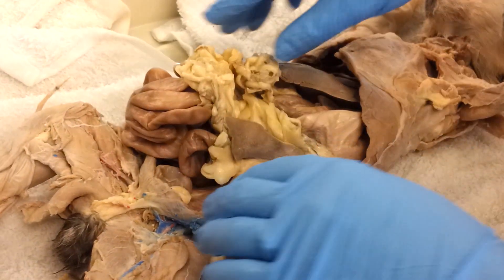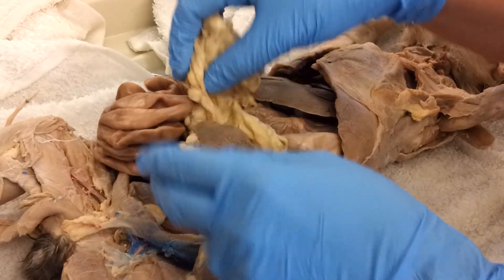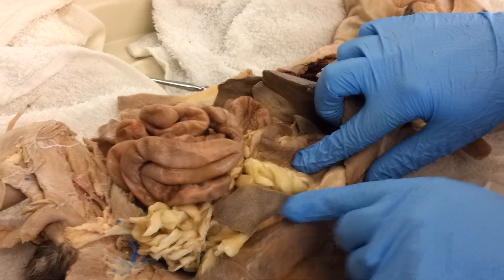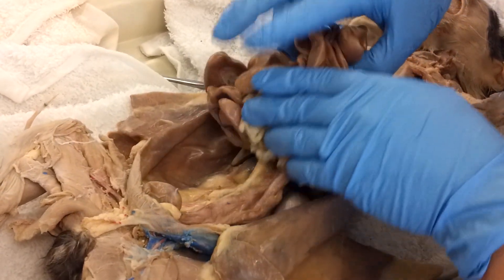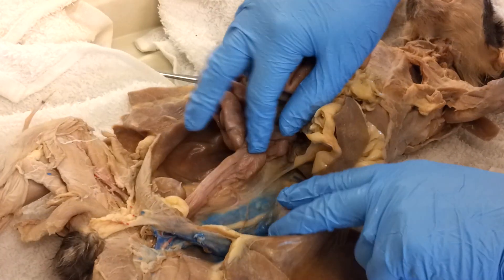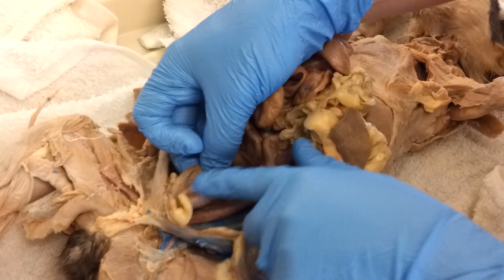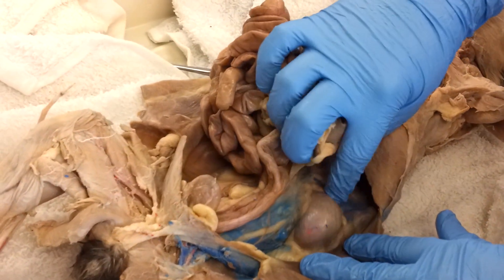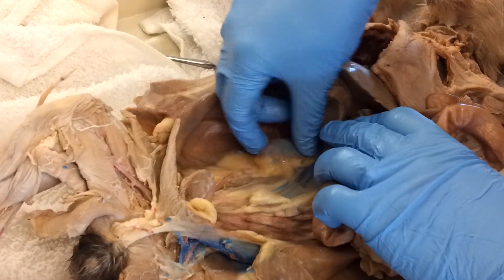From this angle we can see the spleen. If you find the stomach, you'll see the spleen on the left side of the abdomen. This cat is a male, so I don't see any uterine tubes or ovaries, which you would see in a female cat. Here you can see the urinary bladder, and then at the back of the body wall are the kidneys — here's one kidney and here is the other kidney.